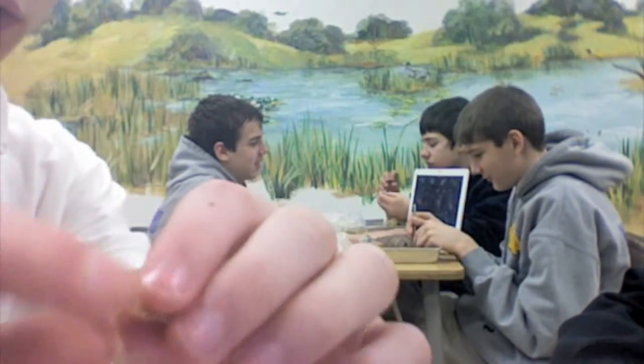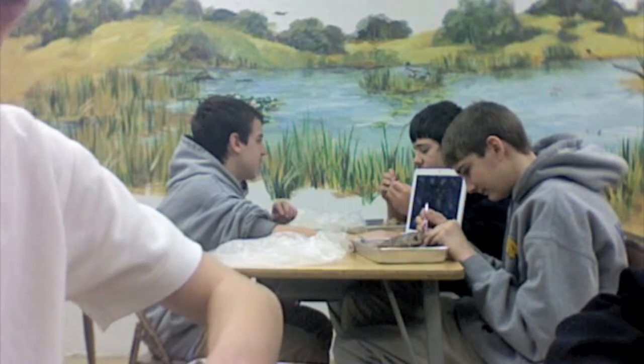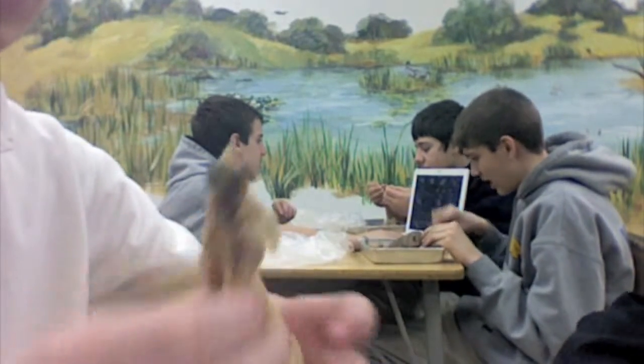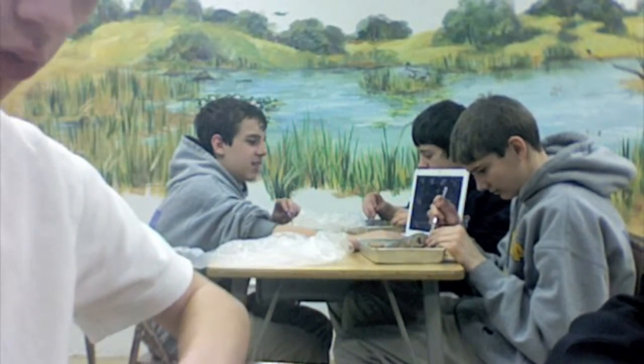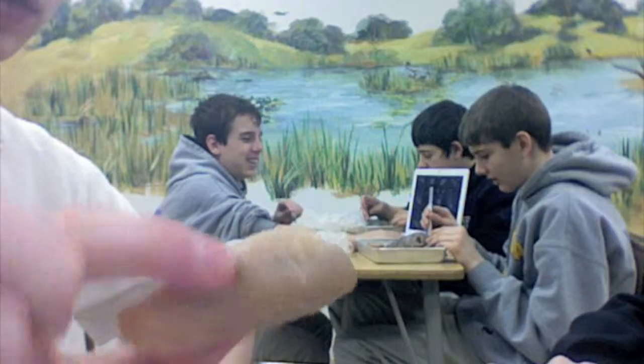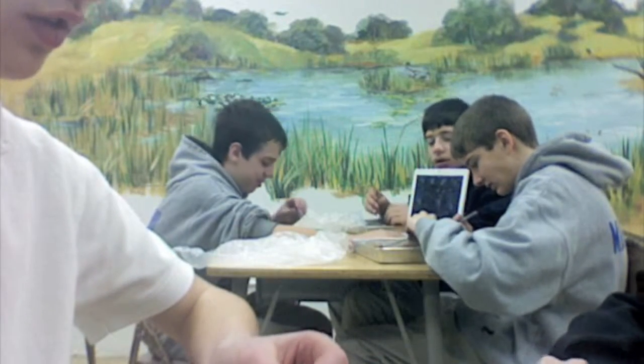Gills. Helps the fish to breathe, if you don't know. Making a total of — there are eight of them. It was female, so that's the egg sac. It blew up — everything became a mess. Blew up before I even opened it.